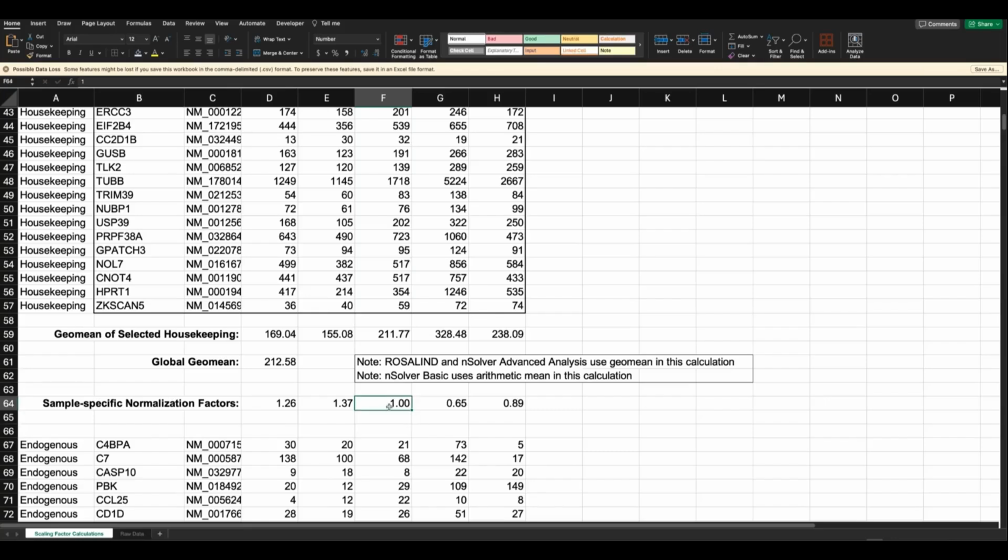So as an example, this is 1. It's basically telling us, within rounding error, that the expression of housekeepers in sample number 3 is basically the same as the average expression across all the samples. In this particular example, sample number 1, it's telling us that the average expression of housekeepers in this sample is basically 1.26 times less than the global geo mean. So it's a great way to identify, when we look across all of these 5 samples, what is the distance of the expression of the housekeepers of, let's say, sample 5 versus the average, or sample 1 versus the average. So that's how you interpret it within the platform.